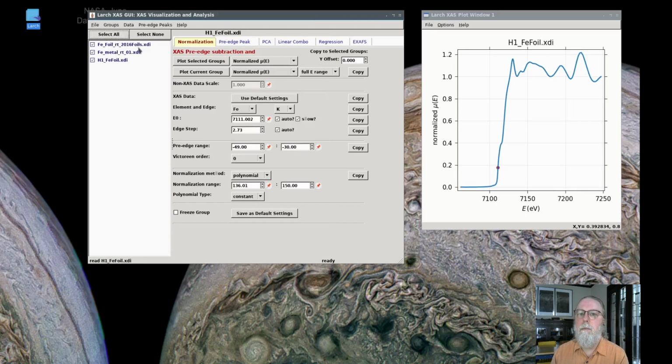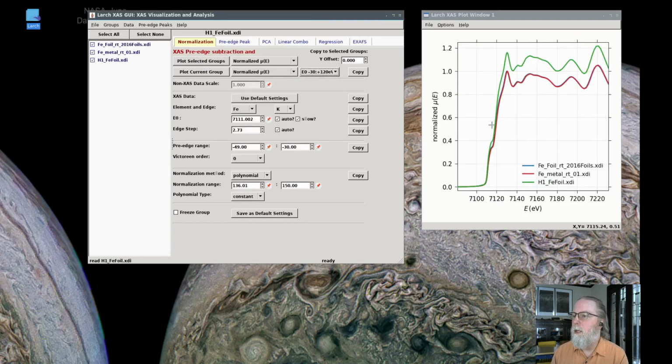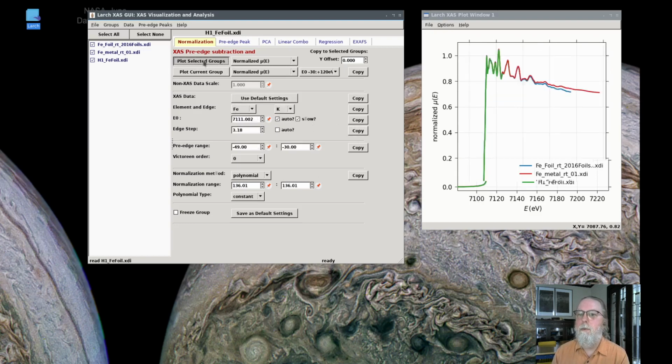So if I select all of these and plot them together, especially if I plot them over the narrow range here, you can see that they're all pretty much the same. This one with a shorter energy range, I should just go tweak its edge step normalization so that they better compare. There's a previous video showing how to do this in more detail. For now, this will do.